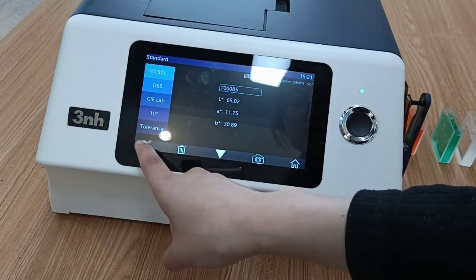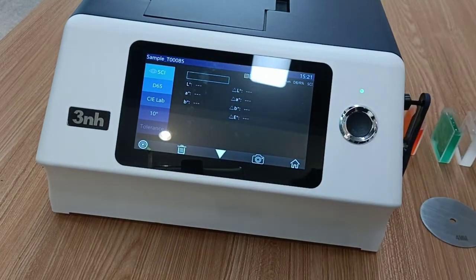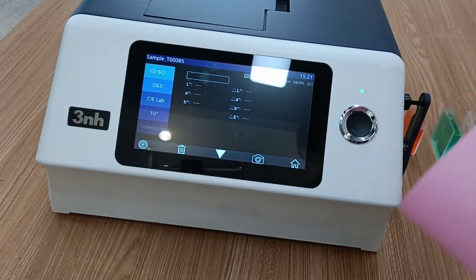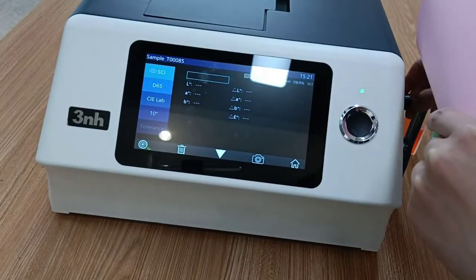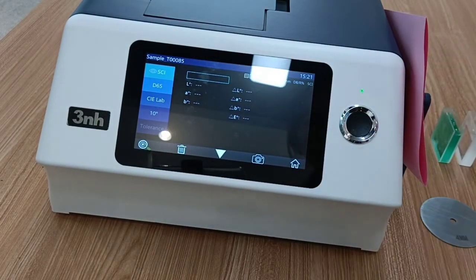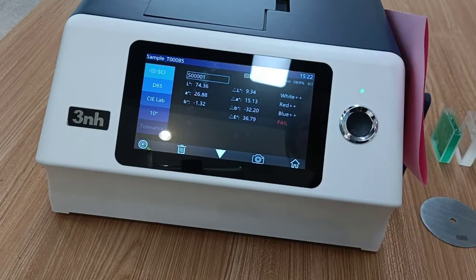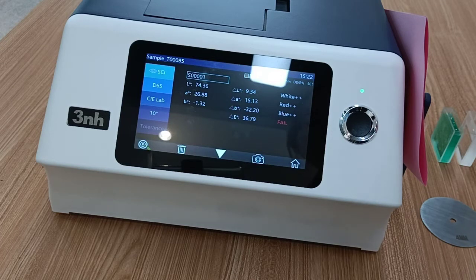Then we enter the sample measure. The sample is a pink paper. Press the measuring button again. We can see the result is fail — it is more white, more red, and more blue compared to the standard.